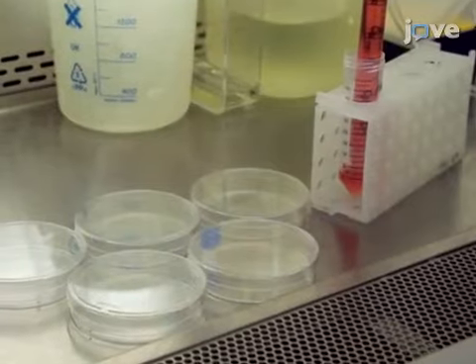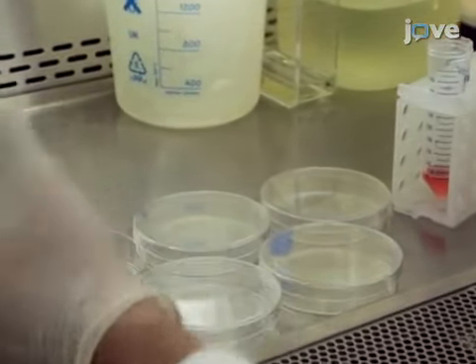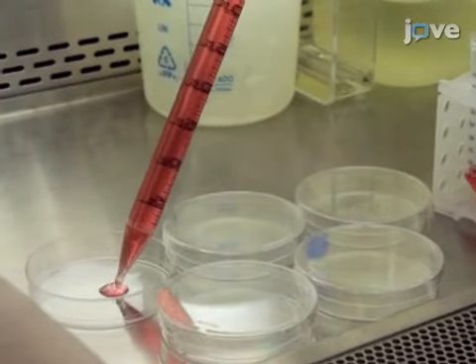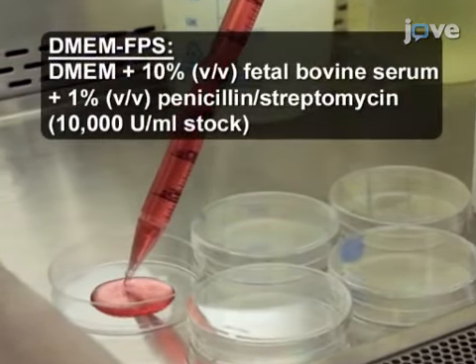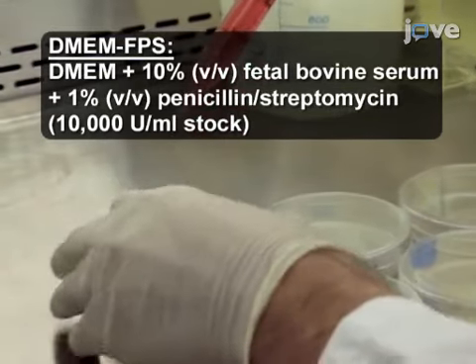One day prior to transfection, plate 3.3 × 10⁶ HEK293T cells in 10 milliliters of supplemented Dulbecco's modified Eagle's medium in each of 5 100 millimeter dishes.